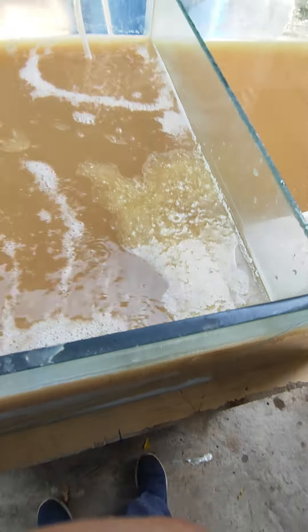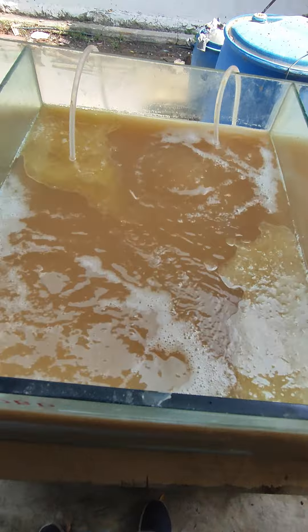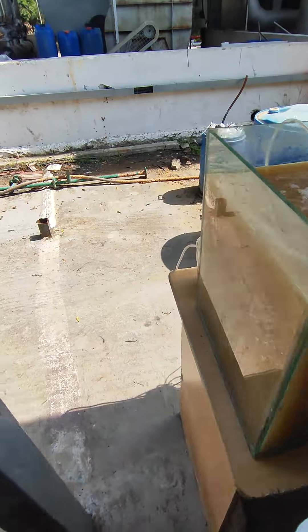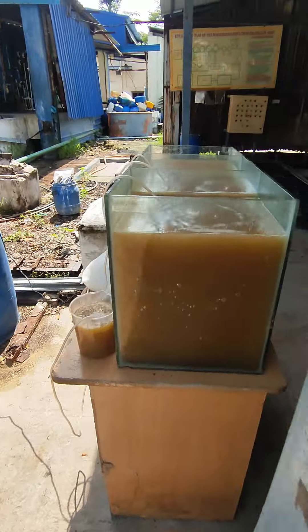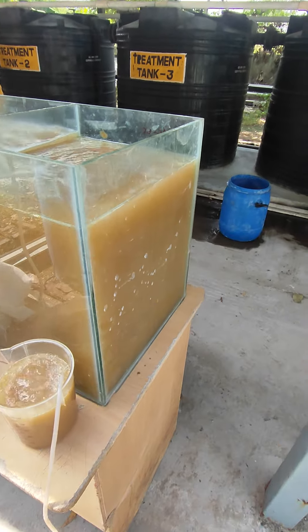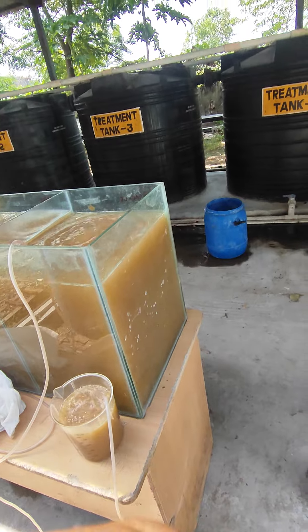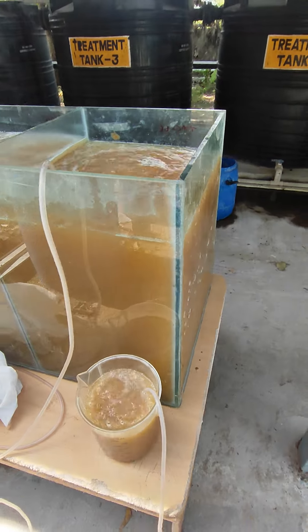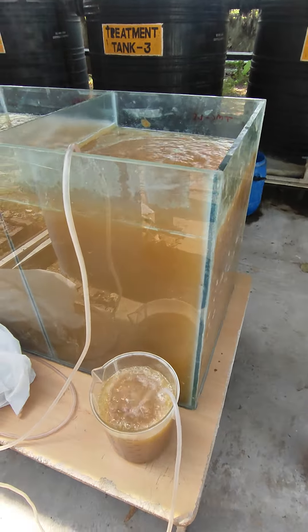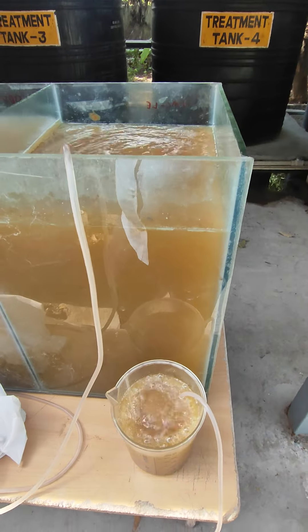This is the oil. The oil content is broken. We use enzymes. The enzymes break the oil. Then we add bacteria. The bacteria will consume the ingredients.